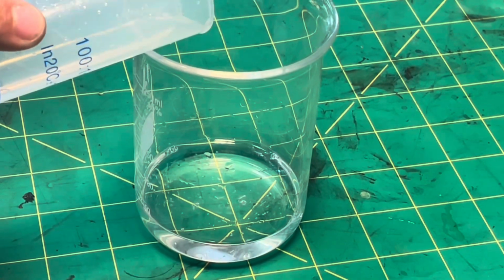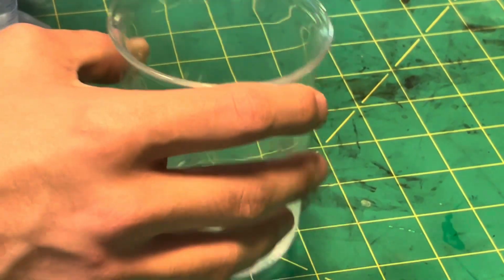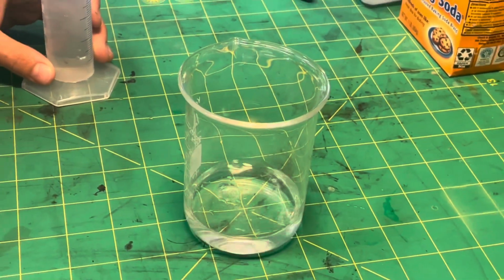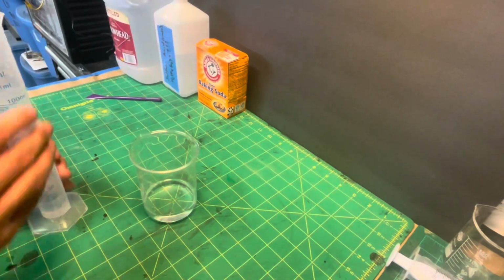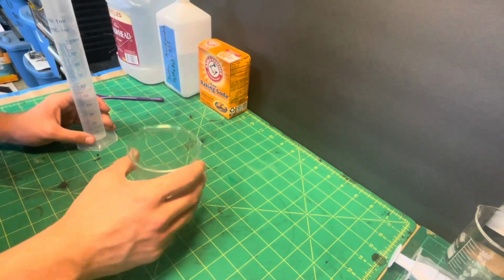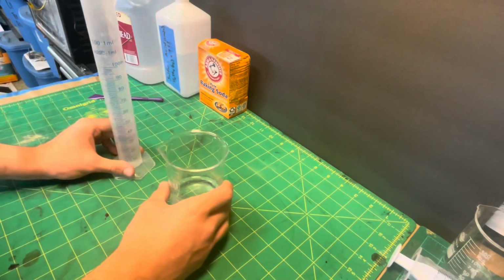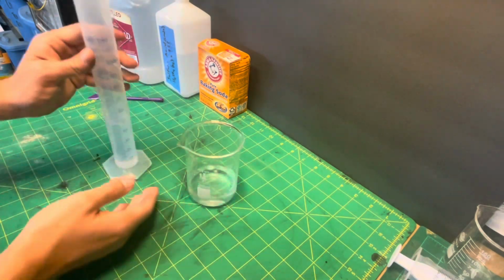Once the sodium bicarbonate solution is mixed, carefully add it to the solution of sulfuric acid. As it's added, it should bubble as carbonic acid is formed and broken down into water and carbon dioxide gas. Once no more bubbling occurs, carefully stop and measure the amount of volume of sodium bicarbonate solution you have left over. Testing with a pH strip should show the solution as now neutral.